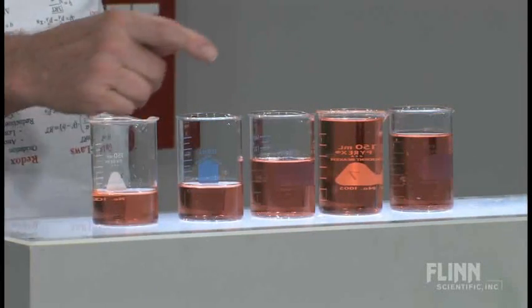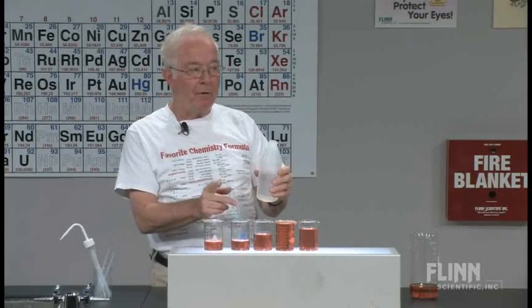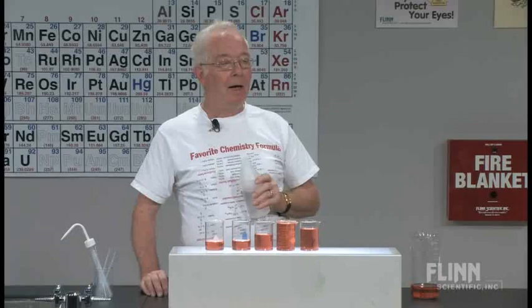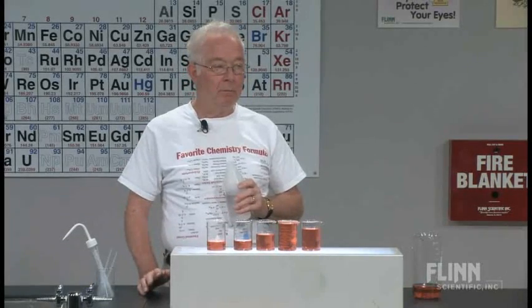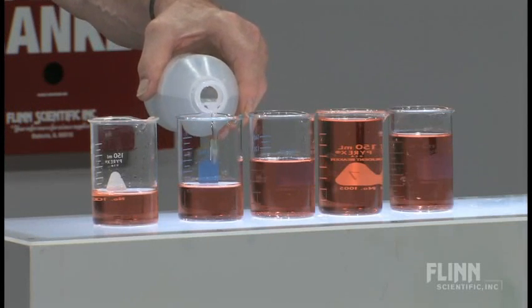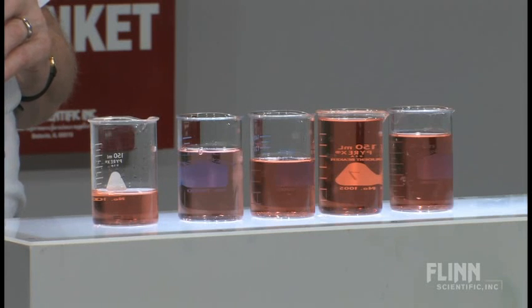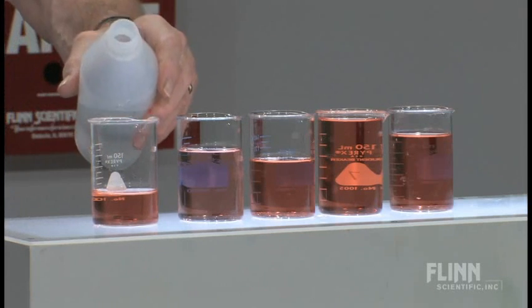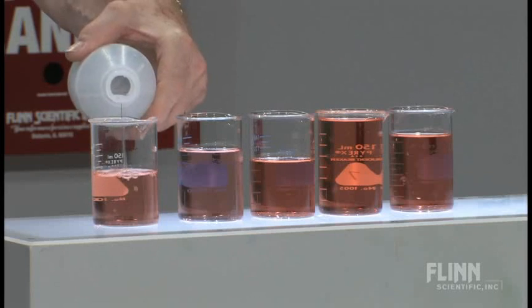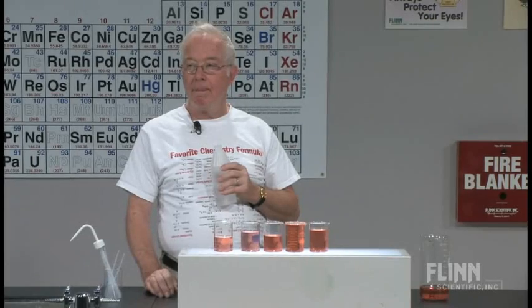This is a red food coloring in water. So I'll add some water, and when I do this, you're going to say: but hey, you're changing the concentration. That's right. If I add water into this, the color will either increase, decrease, or stay the same. Let's look at it at a horizontal view first. And you can see that the color has decreased. Now if we pour less water into this one, it has decreased again, but it's still darker than this one.